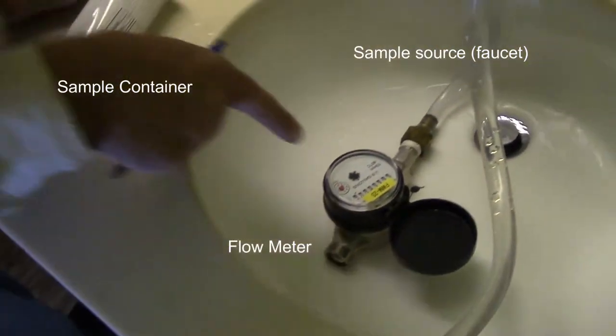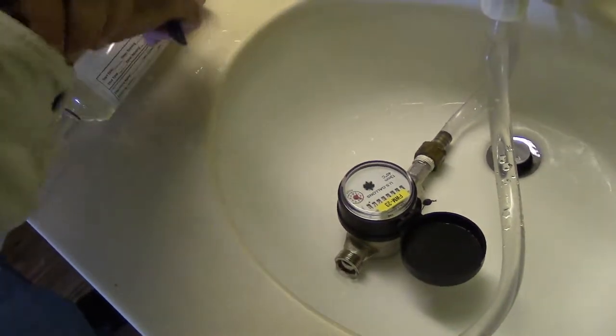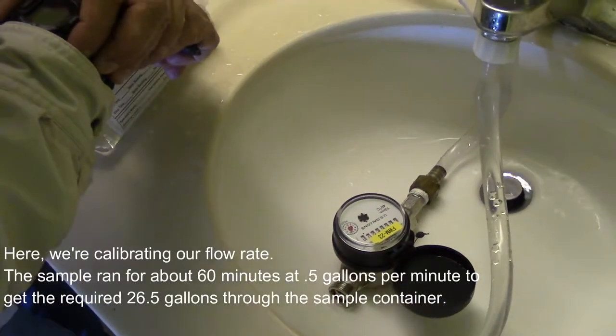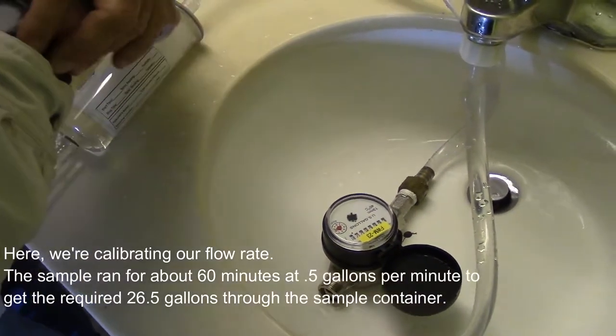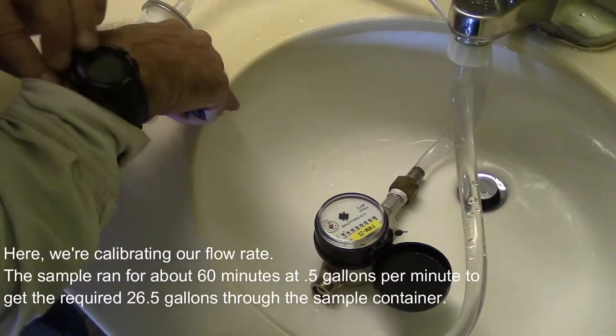6277, or I guess 627.7. Okay, let me see. Let me try to get an idea how fast.